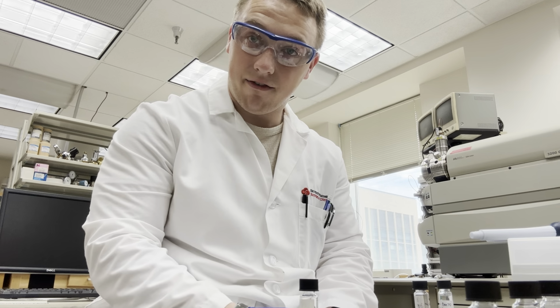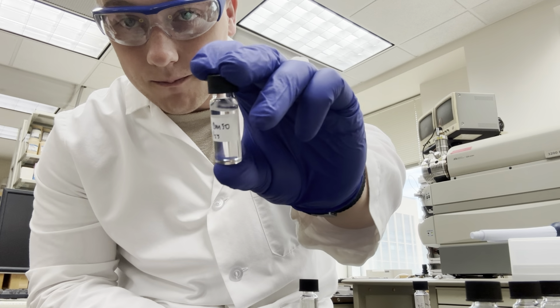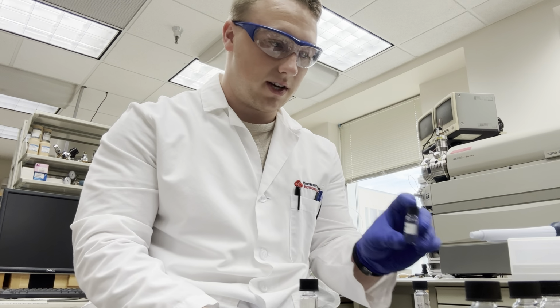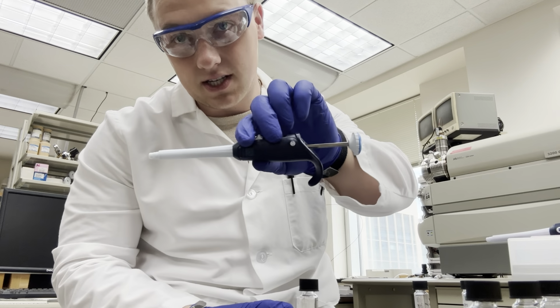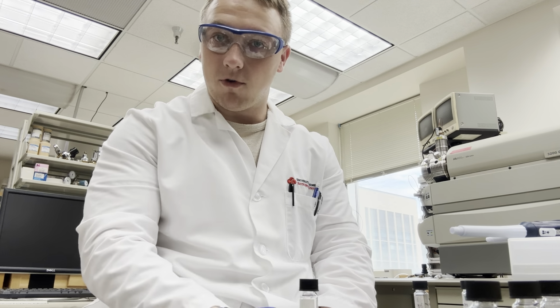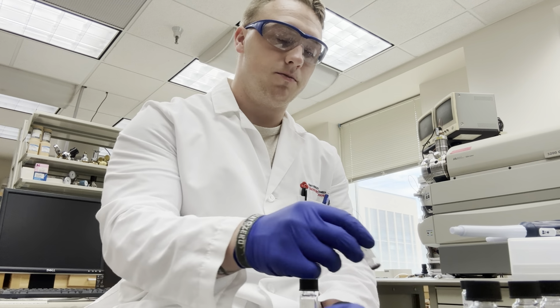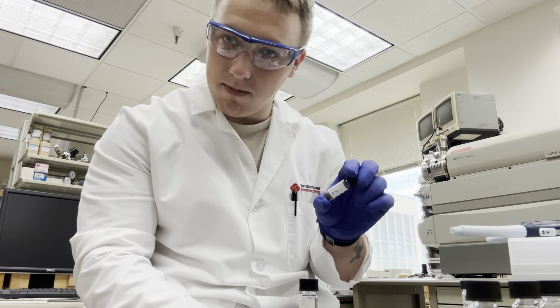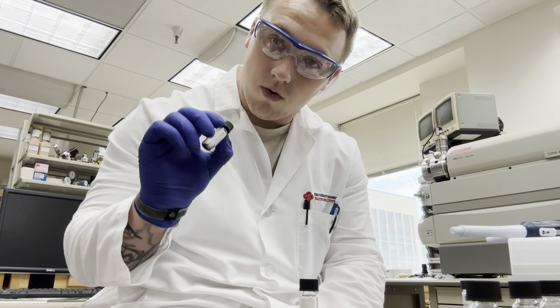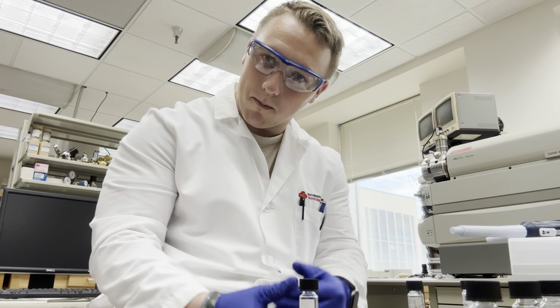Now we have our solvent, which is going to be DMSO, for our Nile Red solution. Since this is a volatile solvent, we're going to be using these positive displacement pipettes. A little different than a normal micropipette, but altogether virtually the same, with some slightly different user things. Now we're going to use the 10 milligrams that we've weighed out and get it down into a working solution. We try to stick with nice, clean numbers.